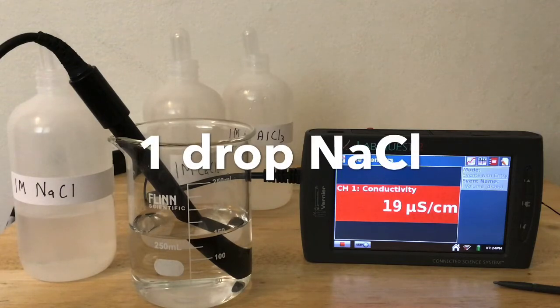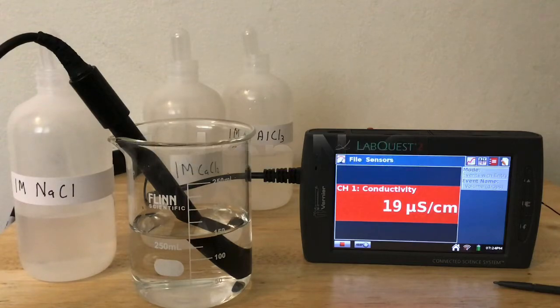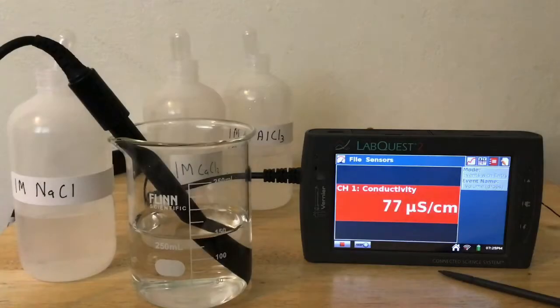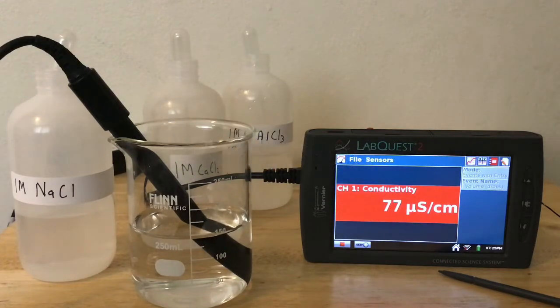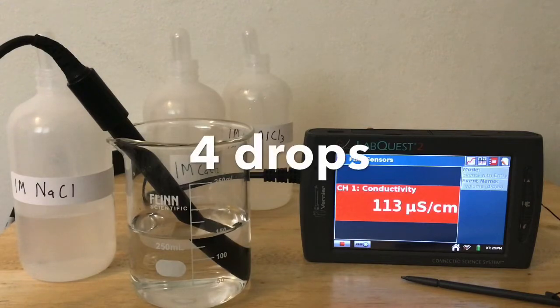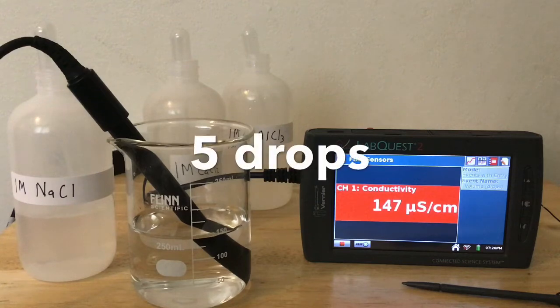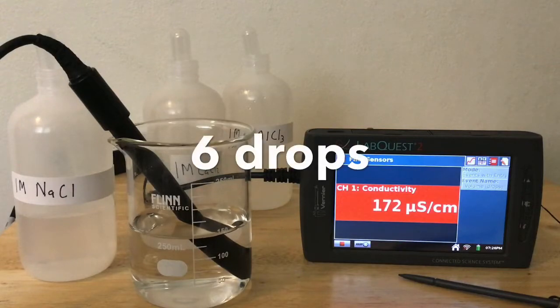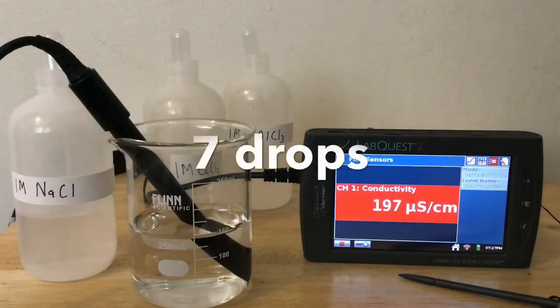This is the conductivity after 1 drop of sodium chloride has been added. 2 drops. 3 drops. 4 drops. 5 drops. 6 drops. 7 drops.